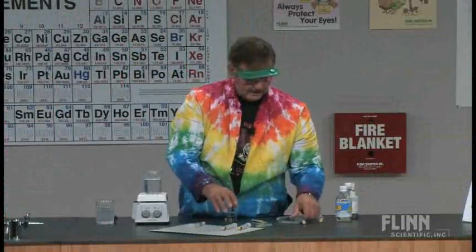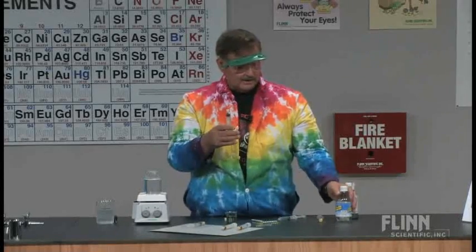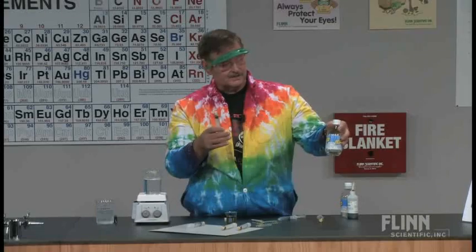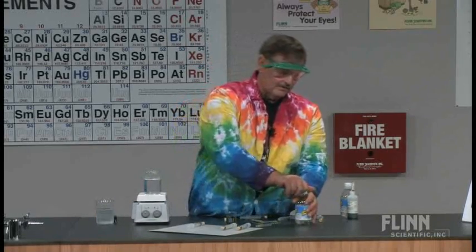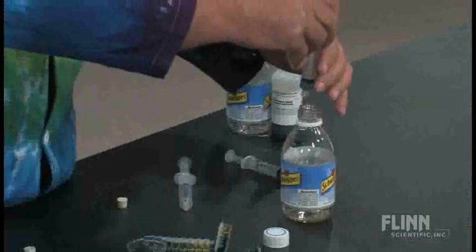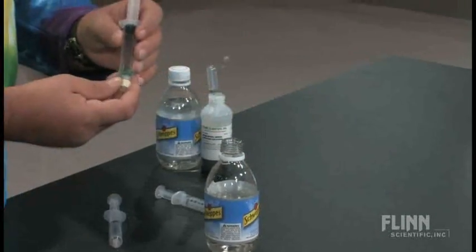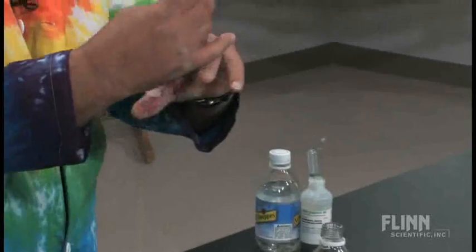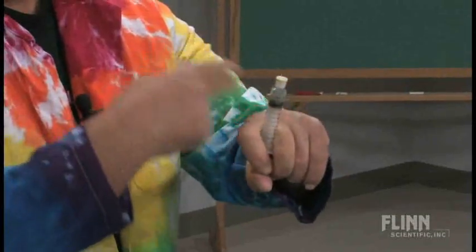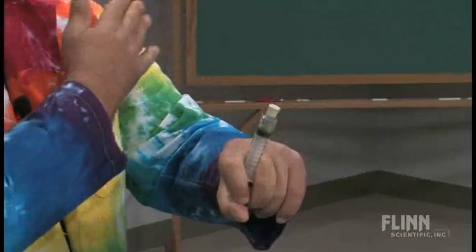The kids will want to know, how do we get back? Well, if you use small bottles of seltzer like this, you have a ready available source of carbon dioxide already inside the bottle. So if you just pop the top a little bit, take the tip cap off, and draw the CO2 back up through, put the tip cap back on, force it back in, and shake - you can force that equilibrium all the way back again.